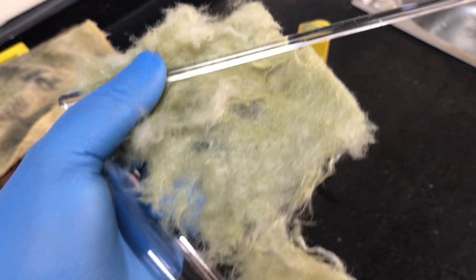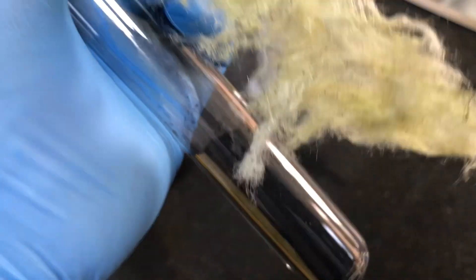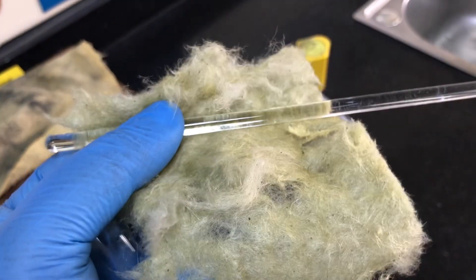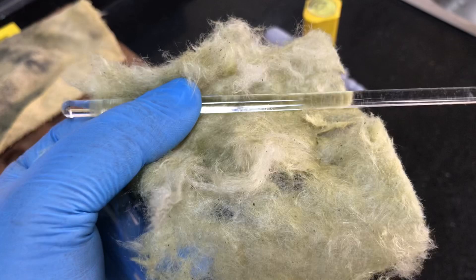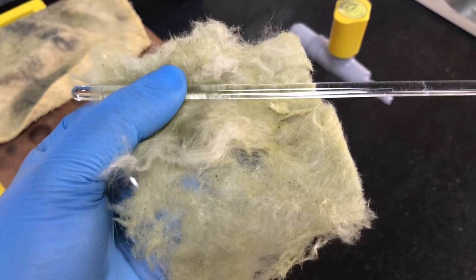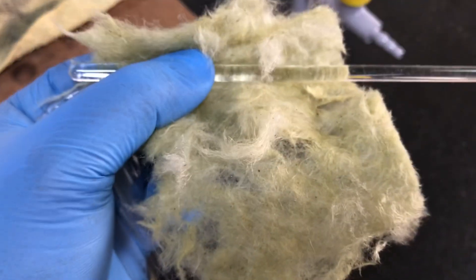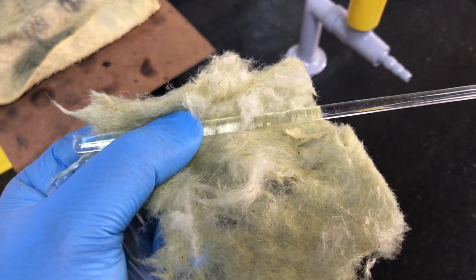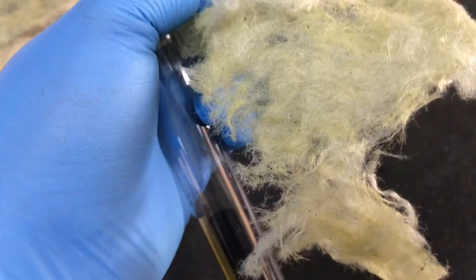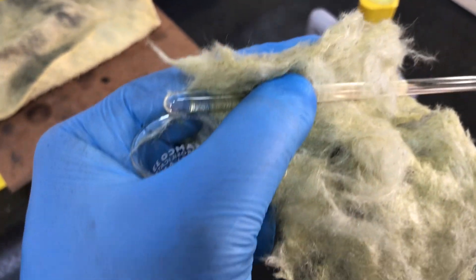Having done this several times and seen the possibility of this actually building up pressure on the inside of the boiling tube and shooting out, what I would recommend is that you use a long sheet of mineral wool. Roll it around so it looks like a Swiss roll. Roll it around a glass rod and then poke it on the inside there. Now if you give it a little more length towards the top you'll then be able to gently fold it, and if there was a whoosh of air then the pressure would actually be reduced because the air could actually escape.